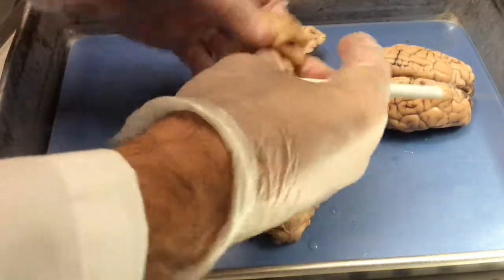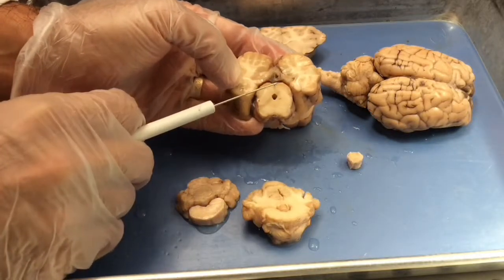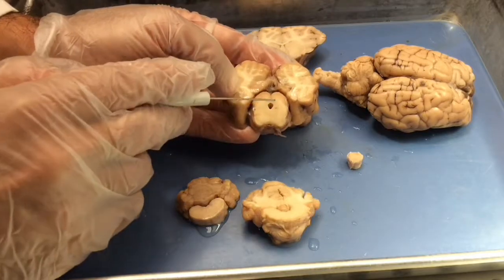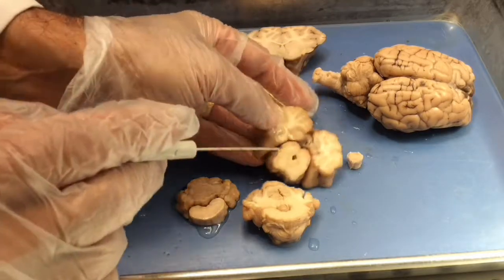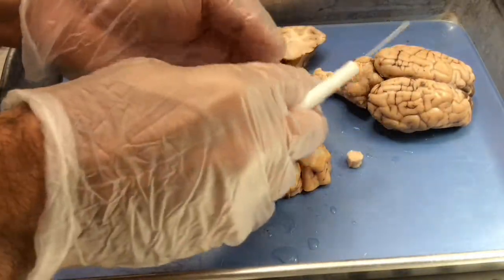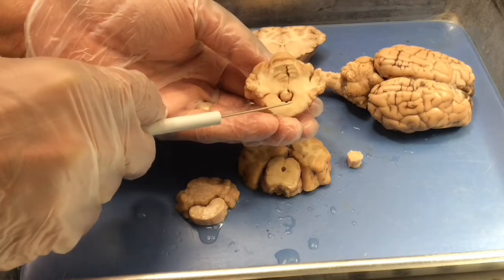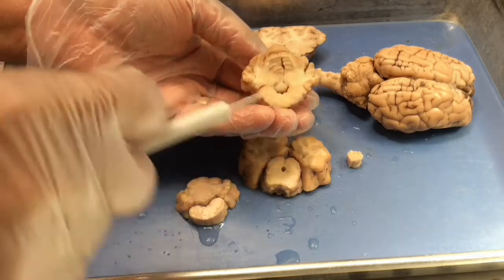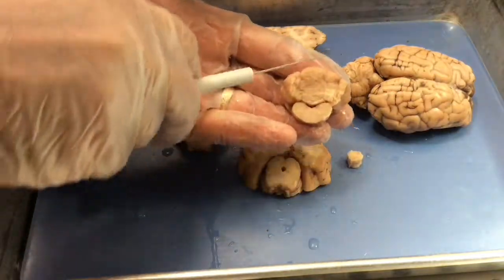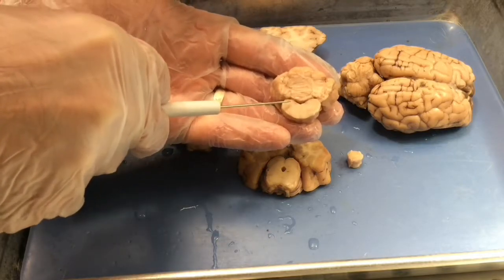Further back now, we're cutting through the occipital lobes, which hang out above the midbrain, the colliculi of the midbrain, the cerebral aqueduct of the midbrain, and the periaqueductal gray. Further back, we've lost cortex. We're completely in hindbrain. We're cutting through the cerebellum. Cerebellum lies on top of the pons, and the ventricle in between them is the fourth ventricle. Still further back, cutting through the back part of the cerebellum, fourth ventricle still visible, and the medulla is visible.